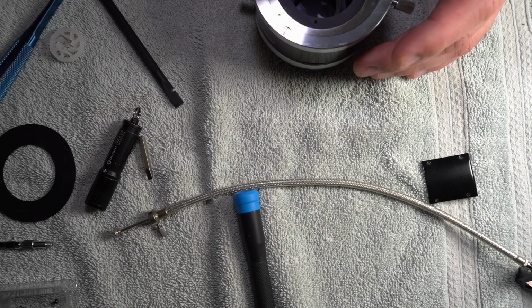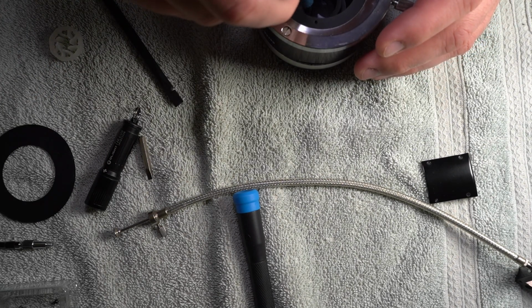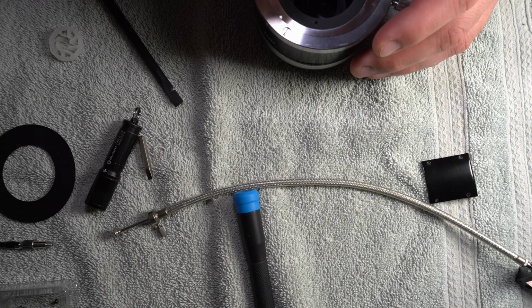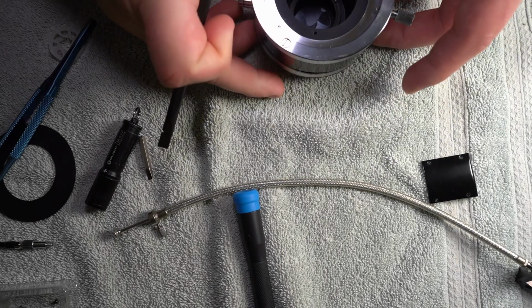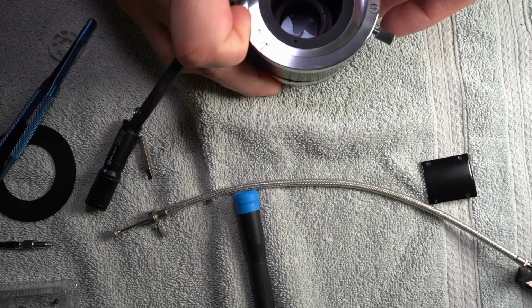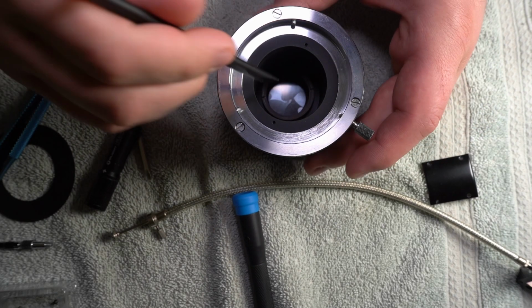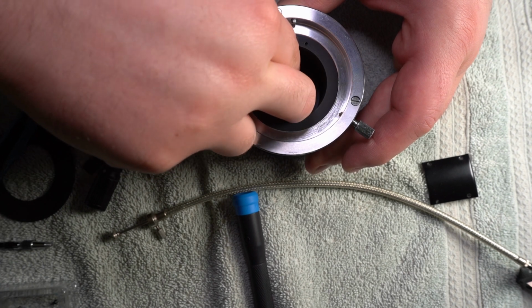And those two, oh goodness, this is going to be a pain to get this in. I said it's going to be a pain to get you in. Hey, I mean, it worked last time. I'm actually going to try and move you over. Oh, that was a mistake. I don't know if you're going to be able to see this or not, really, but take my word for it. I'm putting something in here.